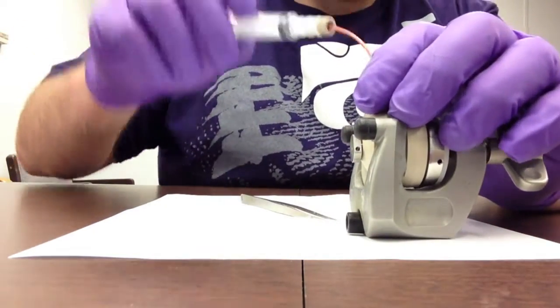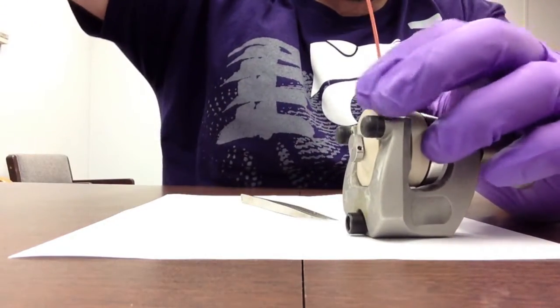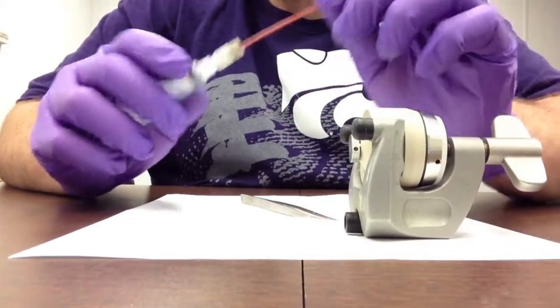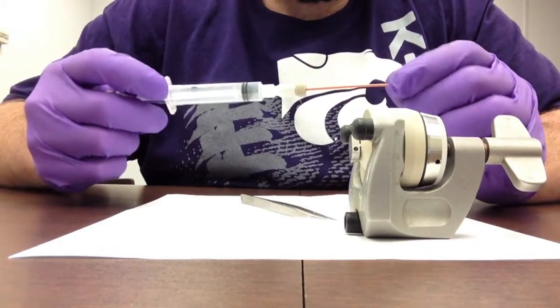Do this a couple times, allowing the electrolyte to pull out as much air in the cell, and replacing it with electrolyte of your choice, and it will be the best fit.